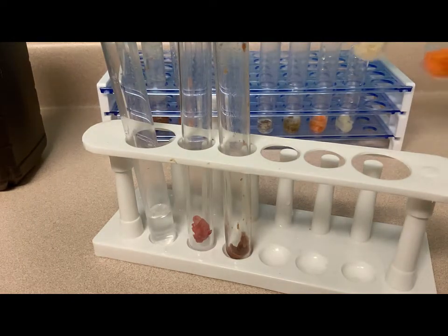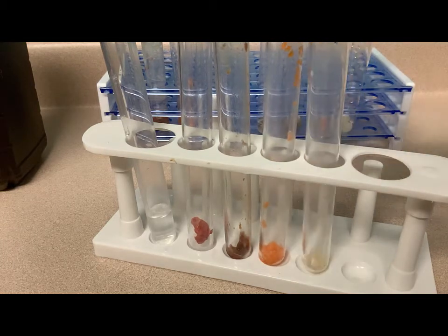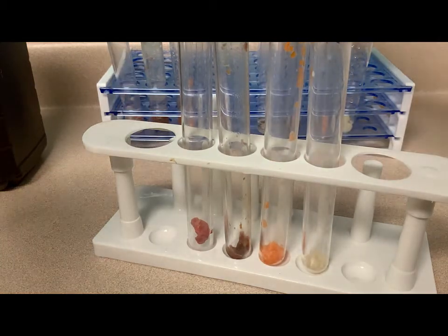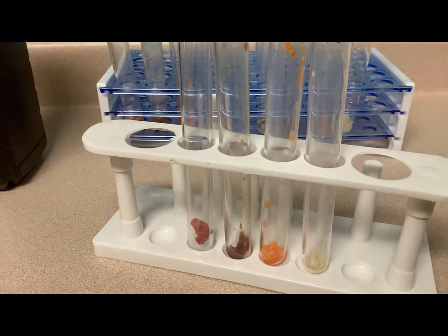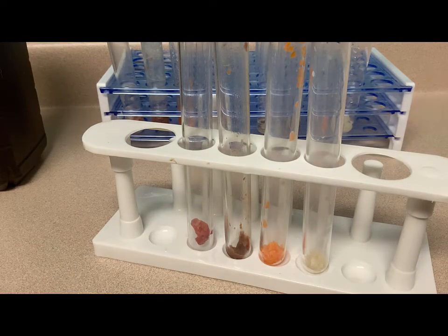In the following control, we are combining the same test substances as before, but instead of hydrogen peroxide, we are adding plain water.